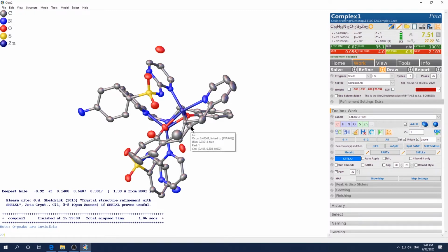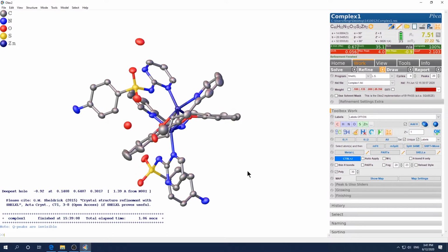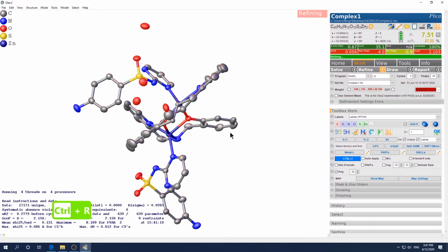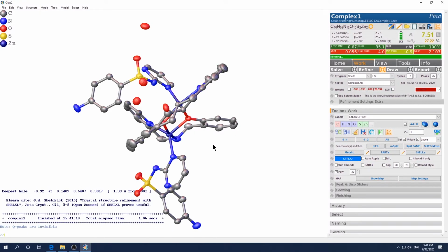So you want to move this to part 2. So part 2 negative 21. Okay, now they are matching size and connected in one part. So just refine again. Okay, it looks much healthier, right?